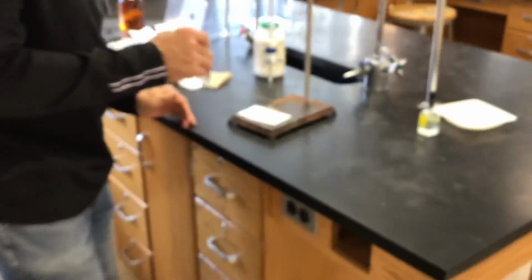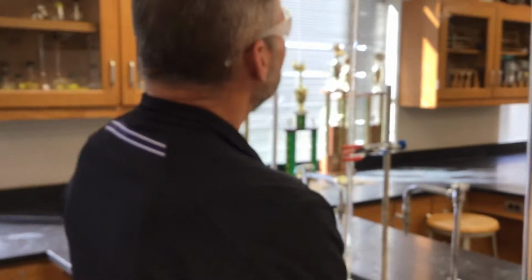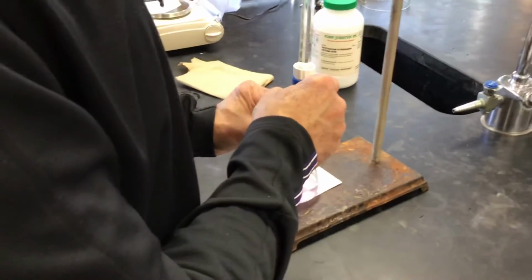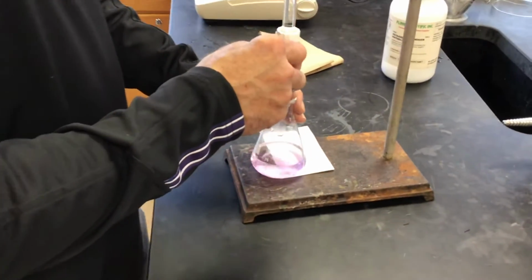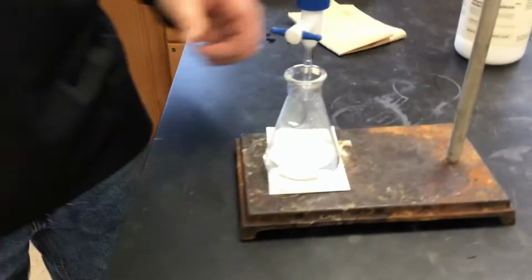All right, so we used about 10 milliliters in our fast and sloppy trial, so I'm going to run in a good 8 at least. Pretty quick. Which is challenging because I have trouble seeing this. There it is. Can you see it? That's 6. 6, 7. Yeah, you got it. Okay, we're coming up on 8. Now get this, there's a big pink wave, but that'll swirl away. It would have been bad if it had been pink. I would have had to start all over.